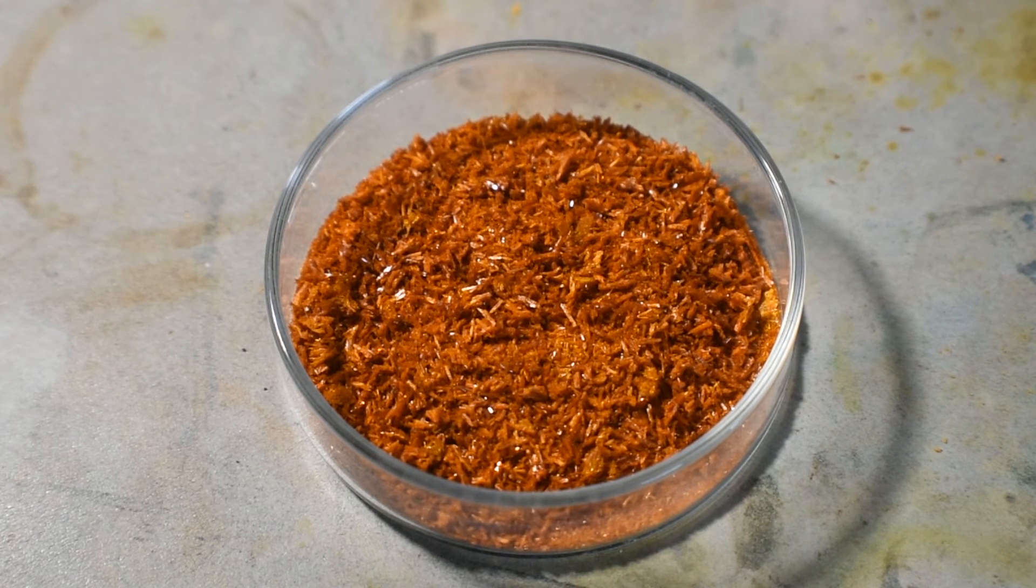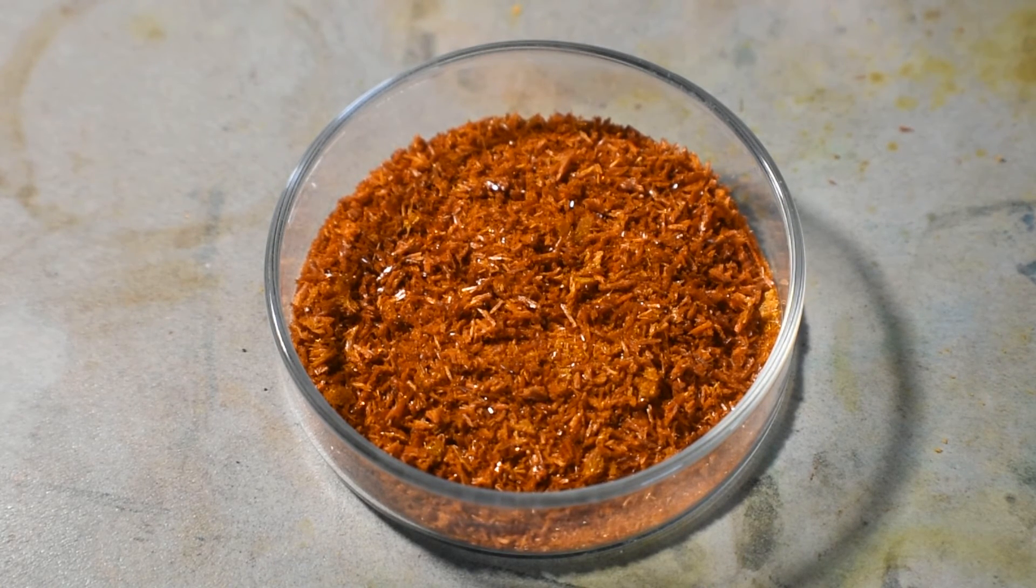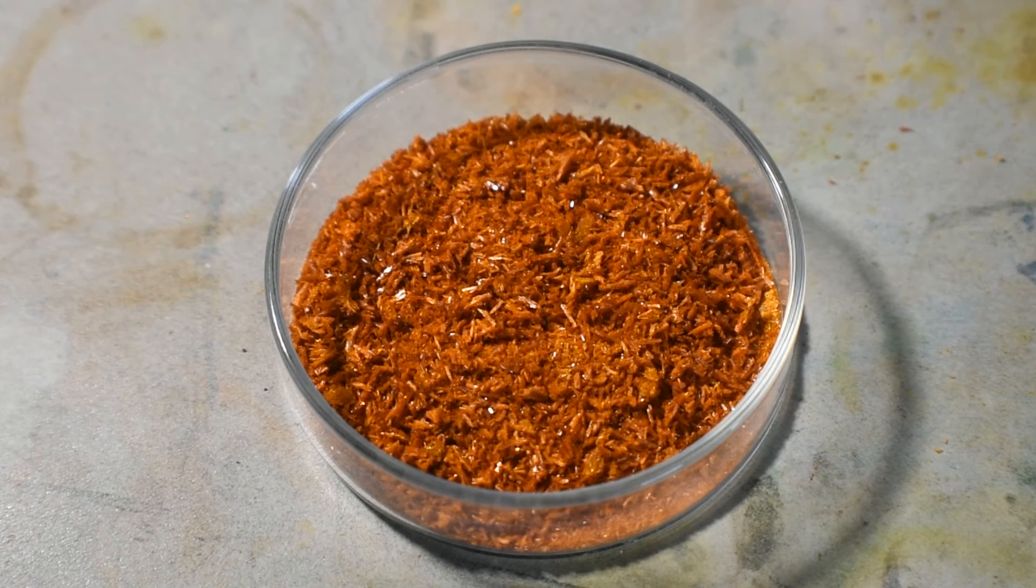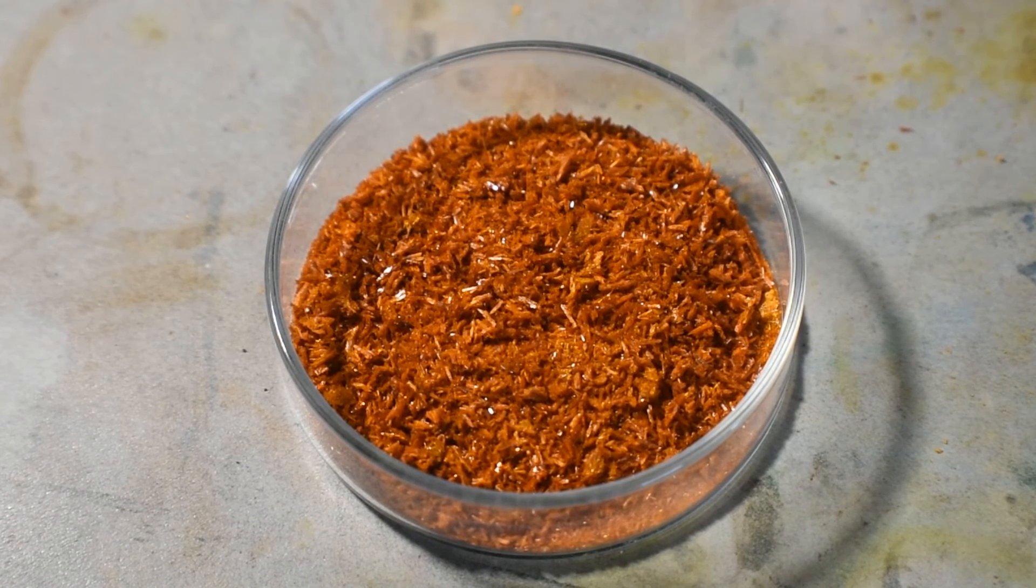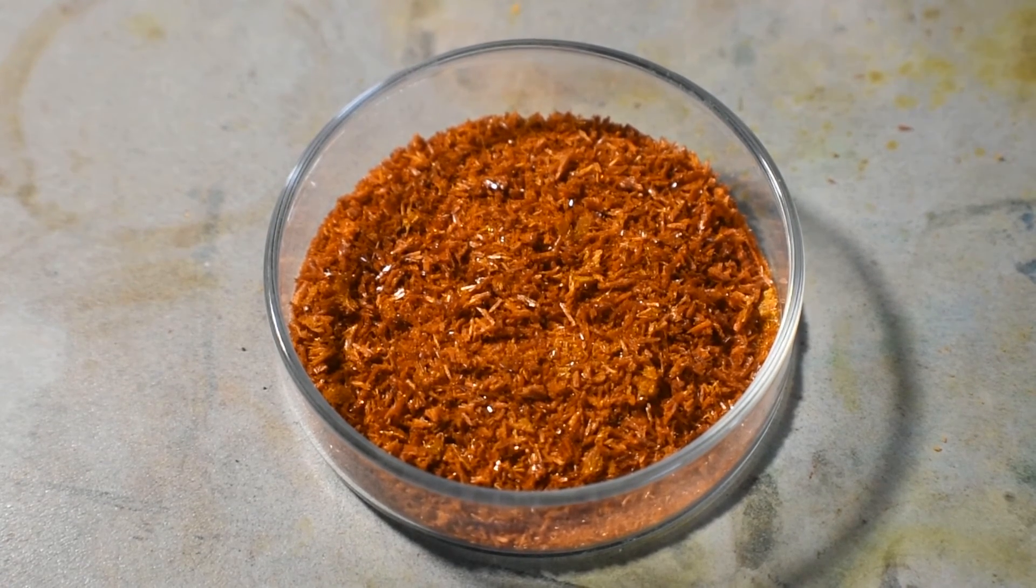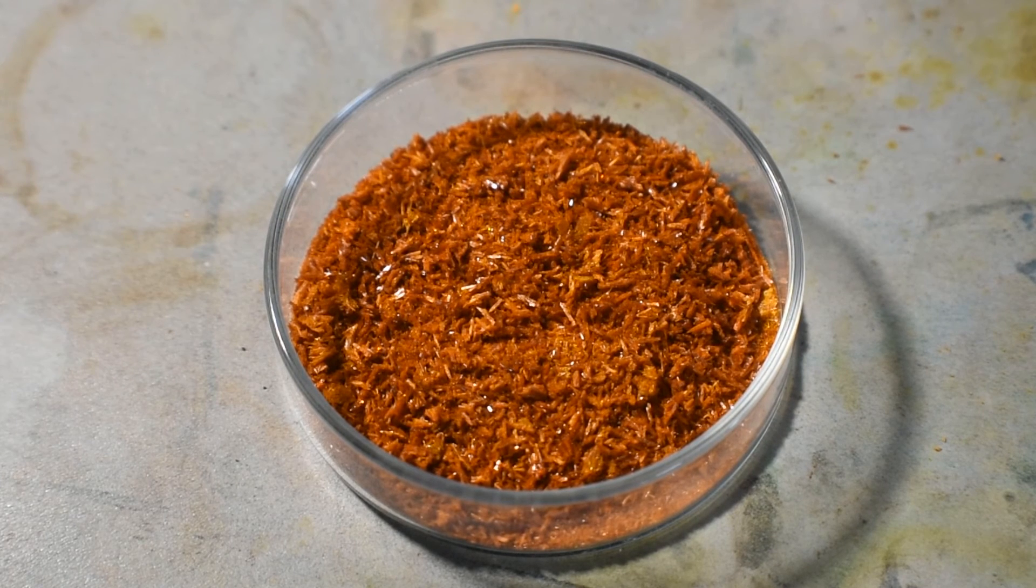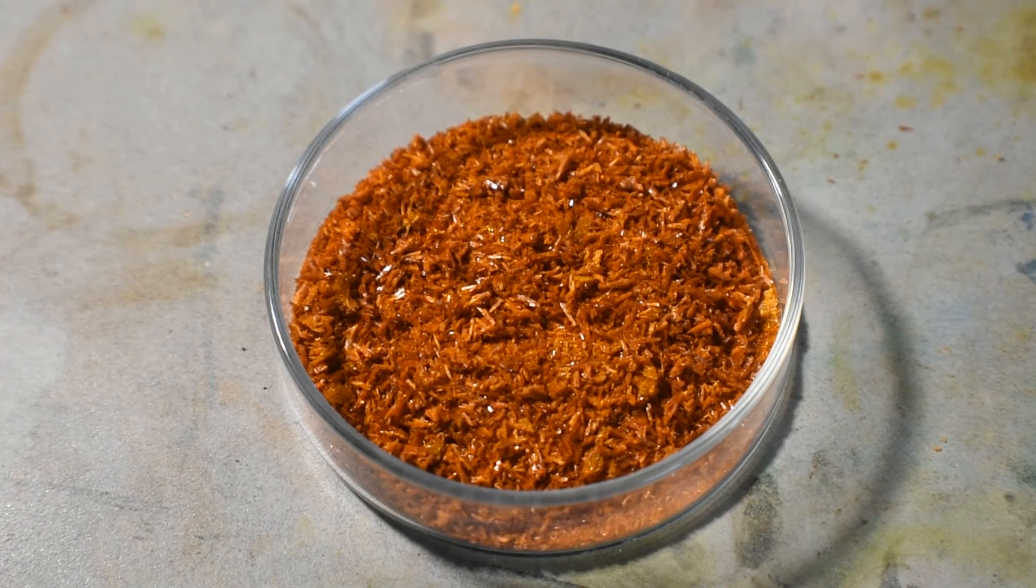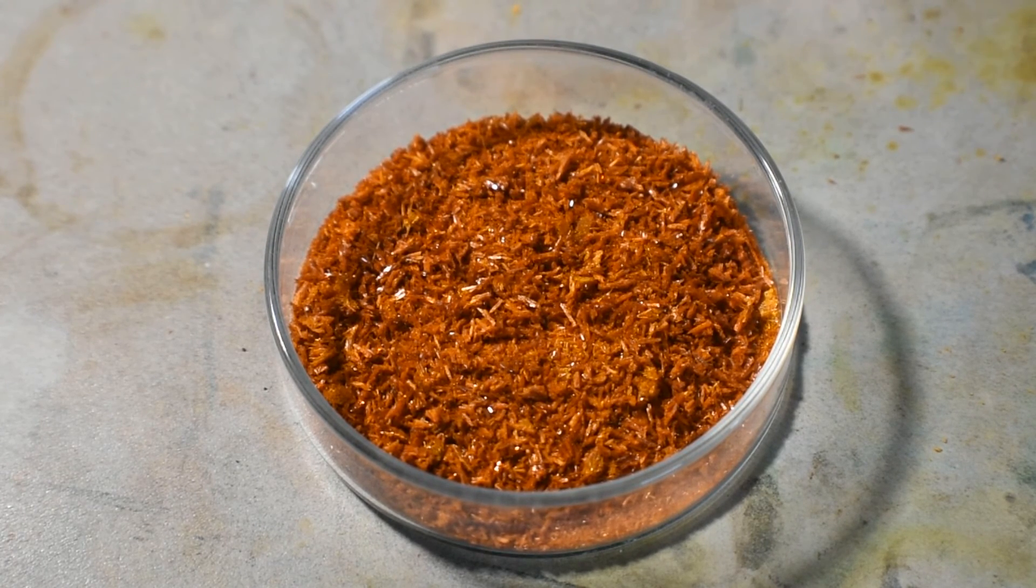I've found some really nice oranges out of this. Apparently, you can make a complex, which is, if I remember correctly, tris(ethylenediamine)cobalt(III) tris(oxalato)cobaltate. So it is the oxalatocobaltate salt of ethylenediamine cobalt(III). But I can't get the oxalatocobaltate synthesis to work, so who knows? I might do that in the future. Apparently it's supposed to be a really nice green, beautiful green color. But for now, I'm afraid it doesn't want to work.